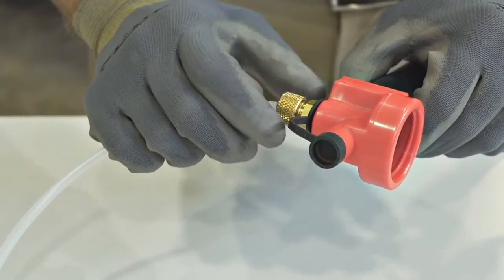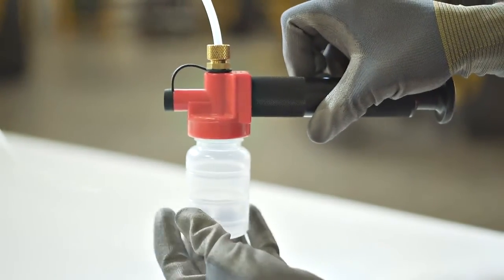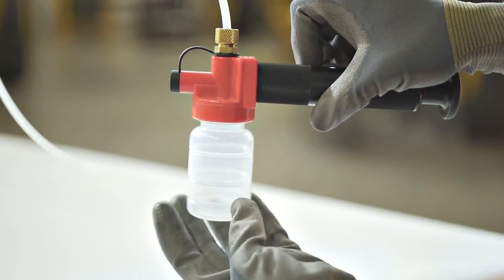Insert the tubing through the head of the vacuum pump and tighten the retaining nut. The tubing should extend about one-eighth of an inch beyond the base of the vacuum pump head.